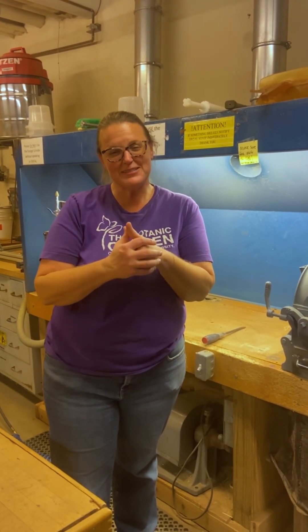Hey everyone! A little behind the scenes of what I've been doing when I'm not working on Oklahoma gardening per se. I'm still working as a horticulture education specialist and I'm doing a little research for my PhD. What I'm doing today is actually grinding some soil samples.